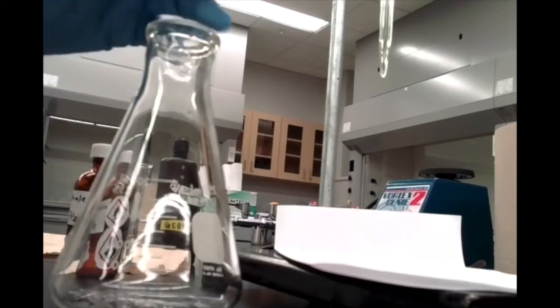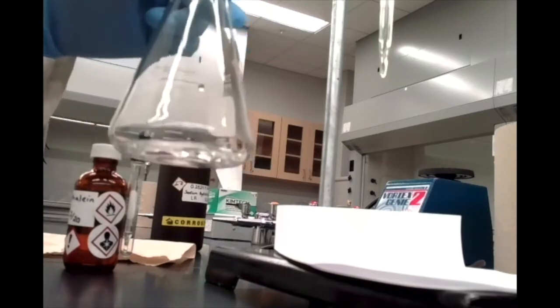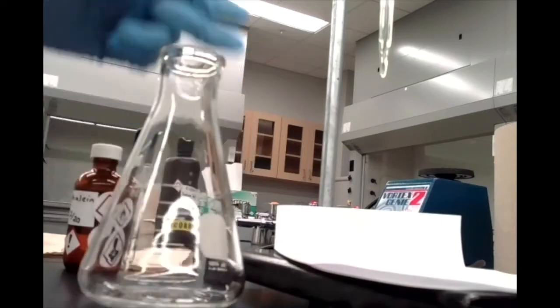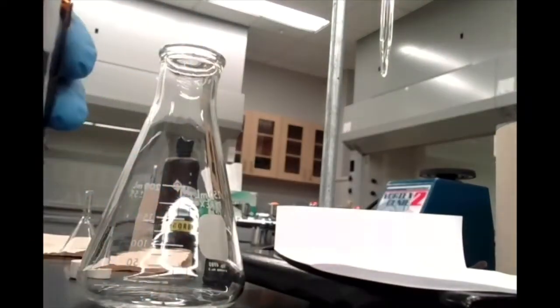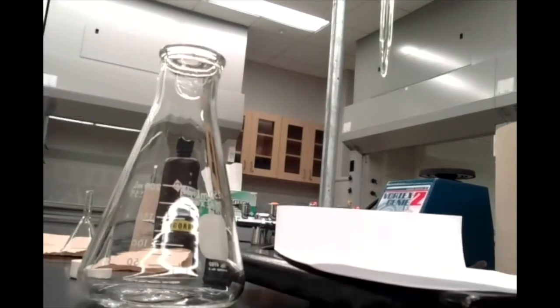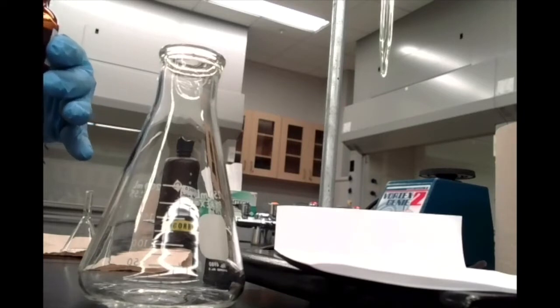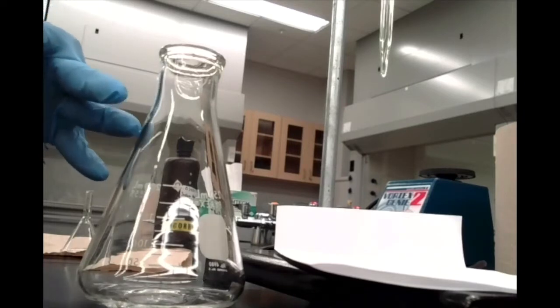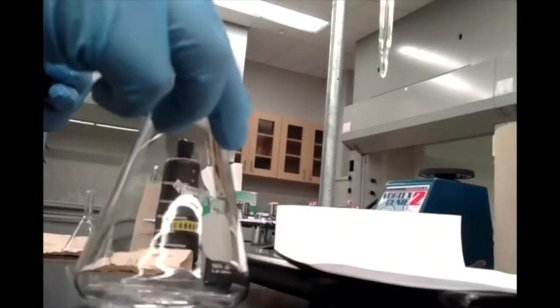Okay, so off camera, I went ahead and added 5 more mils of vinegar to a fresh Erlenmeyer flask. All right. Of course, don't forget we have to add 2 drops of our phenolphthalein indicator to this Erlenmeyer flask. So 1, 2. That, by the way, is the most common problem students run into on this lab. A lot of times students will forget the drops of phenolphthalein indicator, and they add all of their sodium hydroxide, wondering, wait, why am I not reaching the endpoint? If you're ever doing this in real life and you're wondering why that happens, always ask yourself, did I add the indicator? Okay, don't forget the indicator.